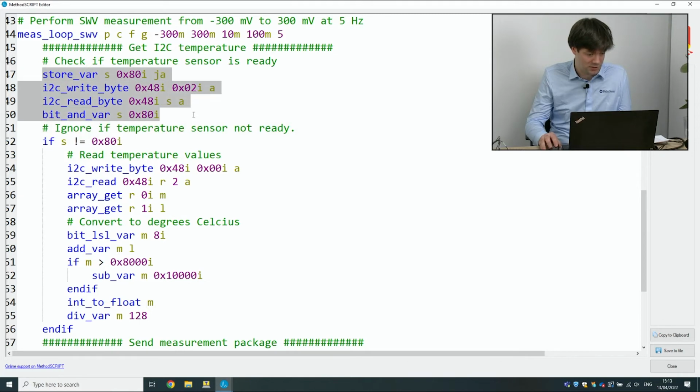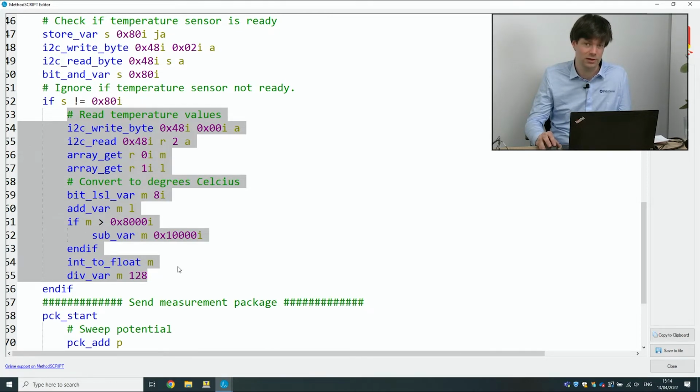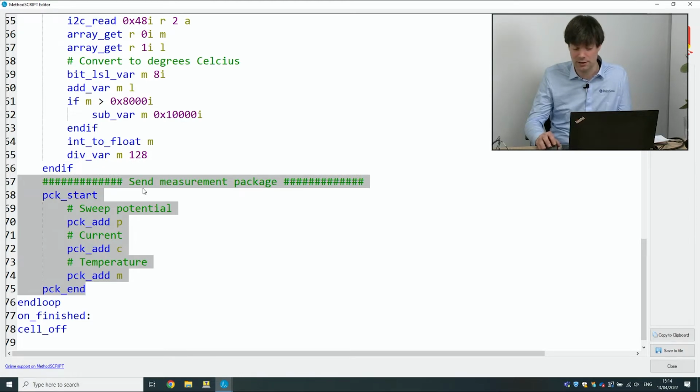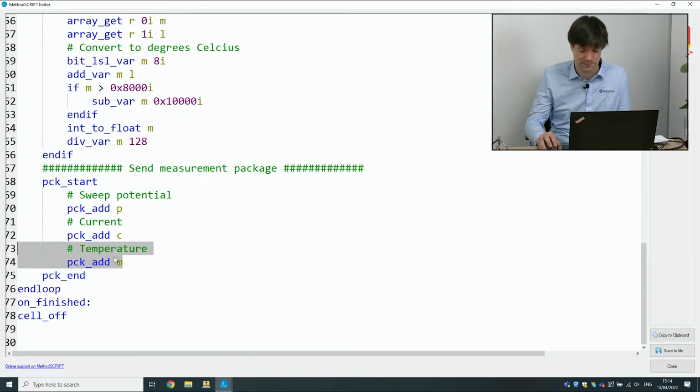So here we're reading out the temperature sensor itself. Then this bit is converting the value from the temperature sensor, which is just a bit value, to a value in degrees Celsius. So we have to do some calculations from the output of the temperature sensor to bring it to degrees Celsius. The last bit of the script is just us sending the data to PSTrace or any other host that might be listening. The sweep potential and the current output are just the normal output of square wave voltammetry. And we've added a temperature to that, so we're going to be able to see that in PSTrace.